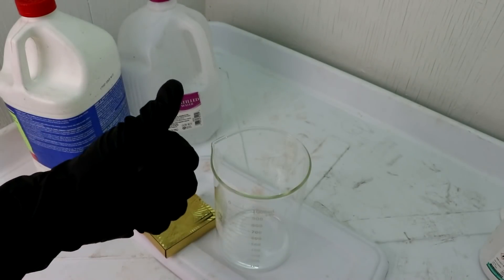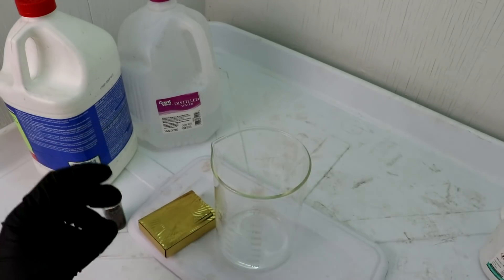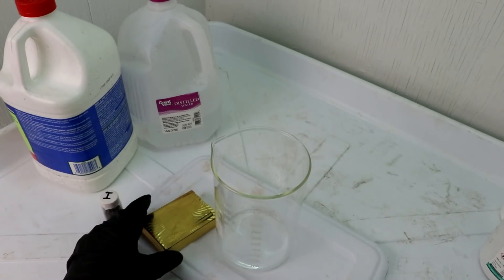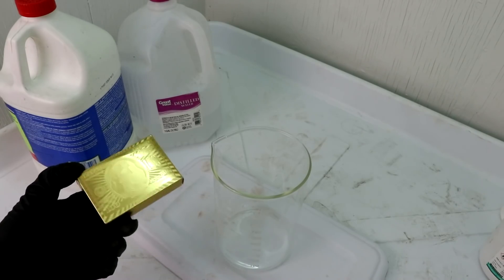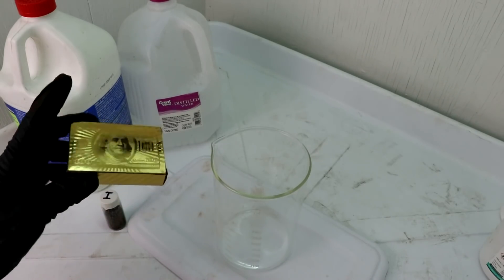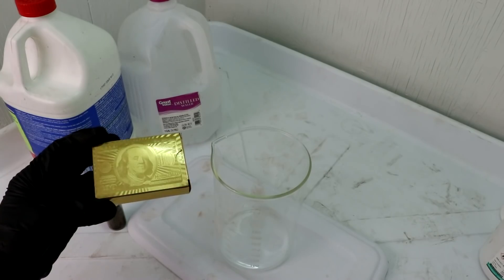Hi everyone, welcome back to Cody's Lab. So I have been wanting to do more of the precious metals refining. I've been kind of neglecting that series lately and so I think we'll start back off with these gold plated playing cards which were sent to me by a fan.